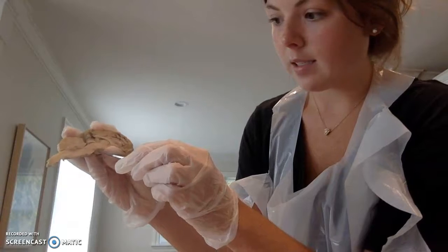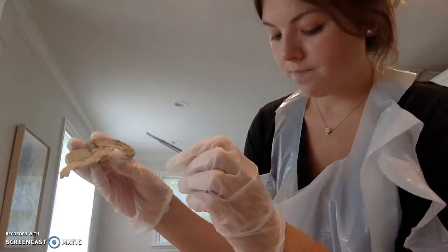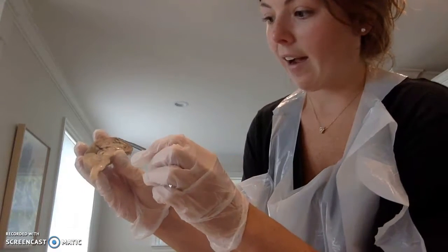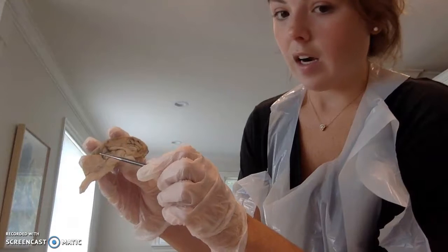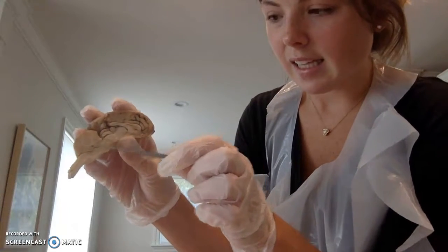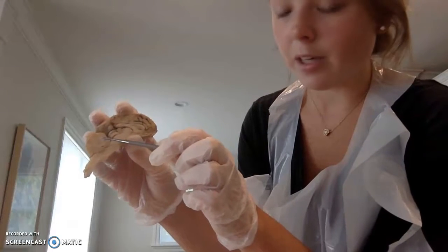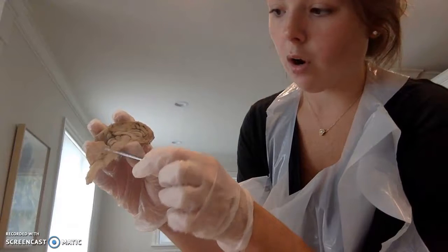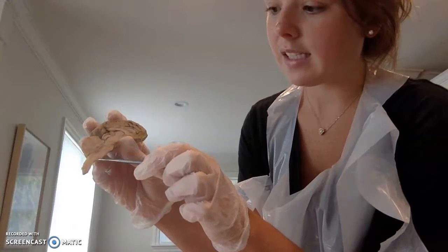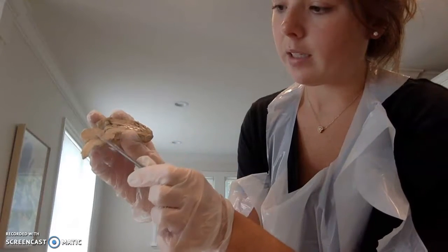The pons is this right here. The medulla oblongata is here. And then in the cerebellum, if you can see the spider web things or branches, like tree branches, that is the white matter, which is also called arbor vitae. And then this is the spinal cord here, and then the brain stem here.